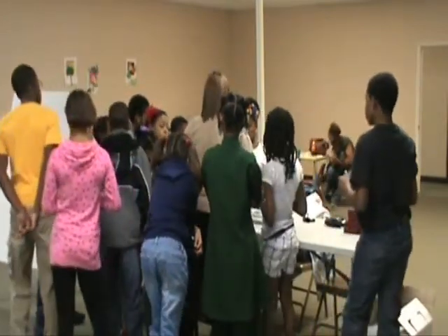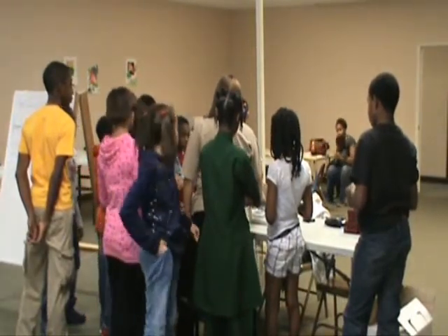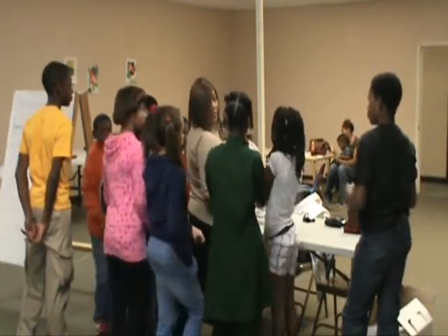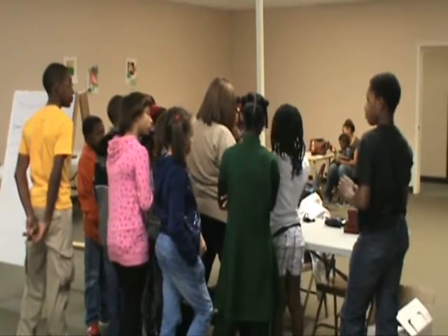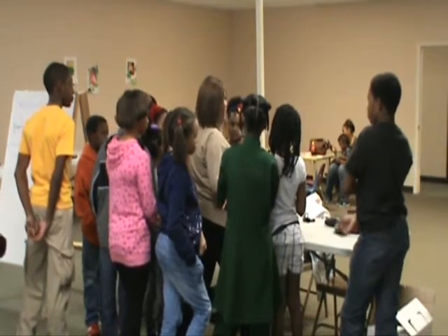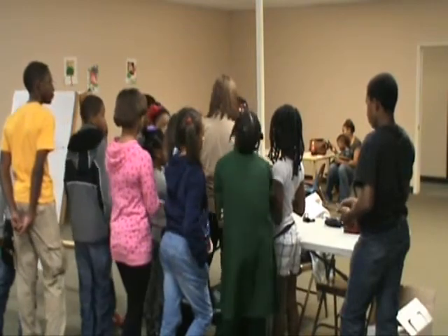Wait, one more thing. Never take him off the balance unless all the riders go back to 0. If you don't take him off and the weights are down here, it starts to mess up the electronics, and the balance loses its accuracy.